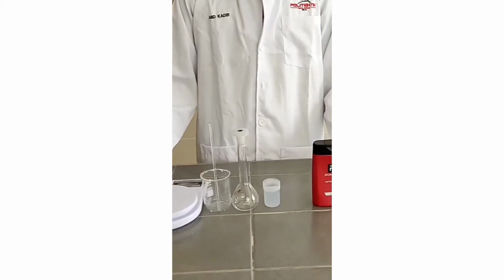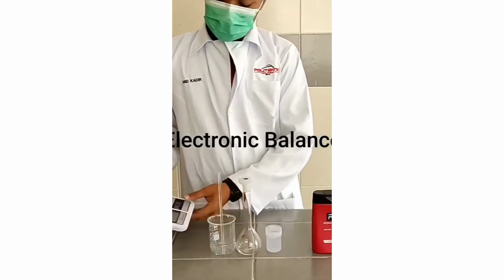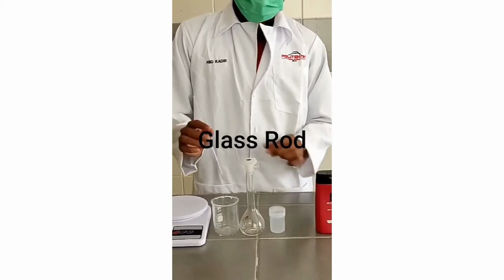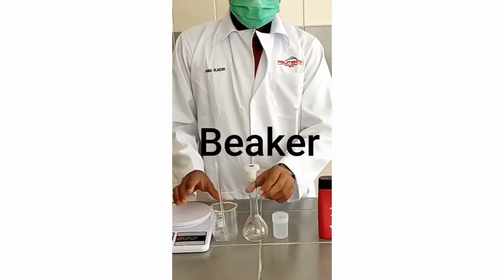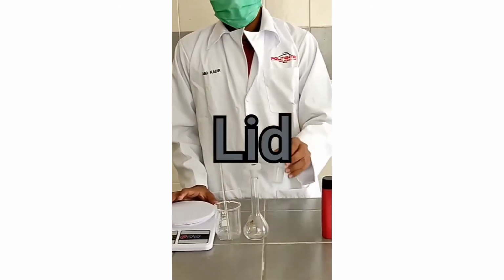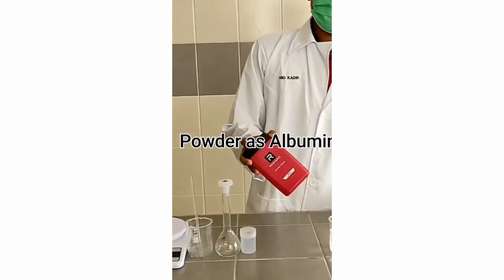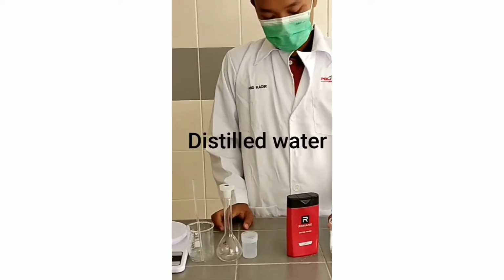The apparatus we will use in this experiment is an electronic balance and a glass rod. The materials we will use in this experiment are albumin and distilled water.